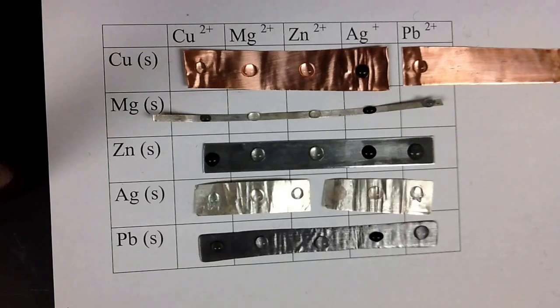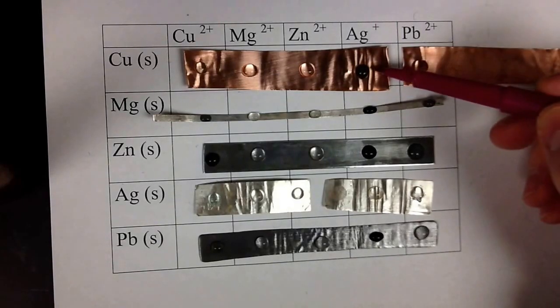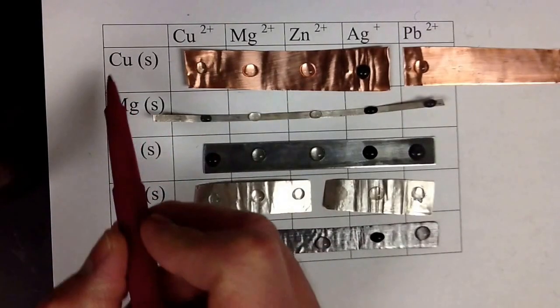So most of our reactions happen pretty quickly. One reaction happens a little bit slower, and actually you don't see any parts where they turn to black, but what you'll see is that you'll see some bubbles. And I'll see if I can zoom in here for a second, but as you look at it now, we're going to try to keep track of how many reactions took place. And the number of reactions with the same solutions is going to tell us how reactive these metals are. So as I look at it now, it looks like we only have one reaction for the copper. And so I'm just going to put a one over here.